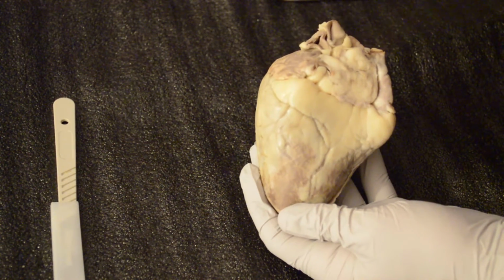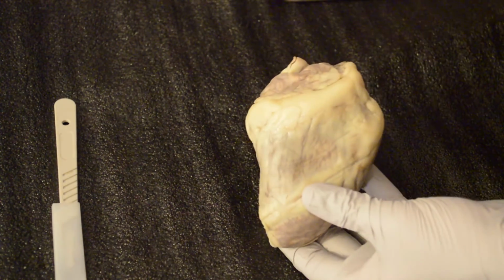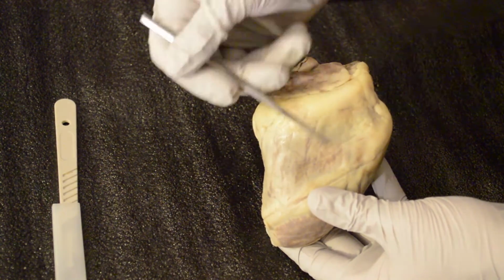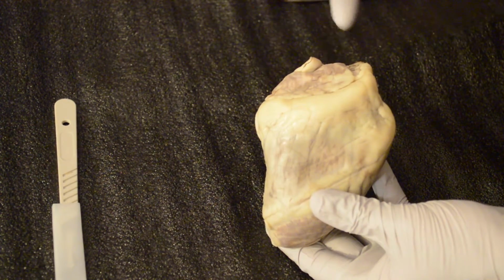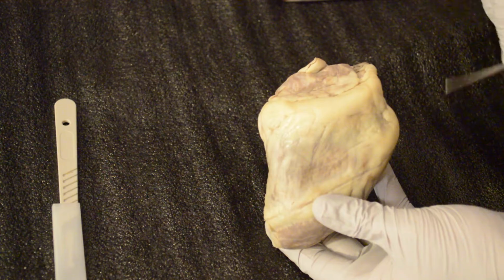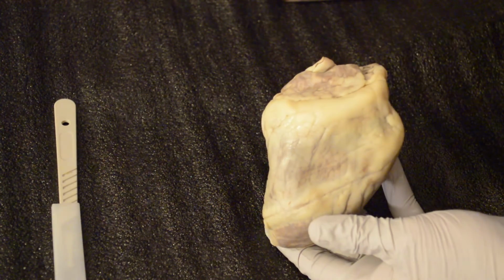Okay, moving on to the aorta, the pulmonary trunk. The pulmonary trunk is going to be more the part where the blood from the right ventricle pushes itself into the pulmonary trunk, into the pulmonary arteries. The pulmonary trunk is going to be that housing factor for the pulmonary arteries. The pulmonary arteries carry deoxygenated blood. It gets shot over and into the lungs, gets oxygenated, comes back into the pulmonary veins, and goes into the left atrium, and it eventually goes again into the left ventricle, which pushes out to the body.